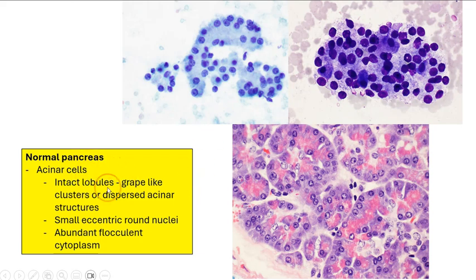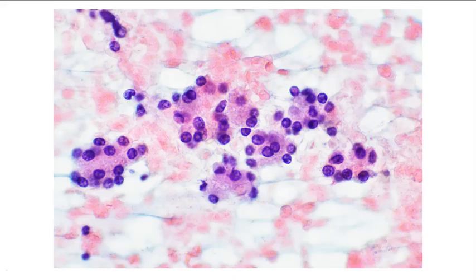As mentioned, the acinar cells can occur within intact lobules as grape-like clusters, or they can occur as more dispersed acinar structures. The cells have small, eccentric, uniform, round nuclei and abundant flocculent cytoplasm. And usually we do not see prominent nucleoli, and we don't see salt and pepper stippled chromatin like we would see in a neuroendocrine tumor. So this is a higher magnification view of the normal pancreatic acinar cells. Note the very classic acinar arrangements.